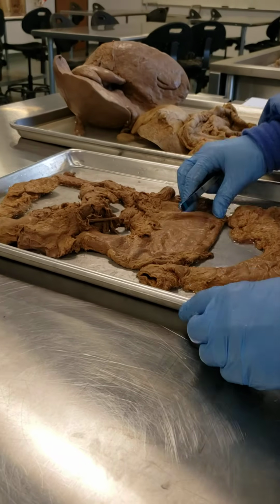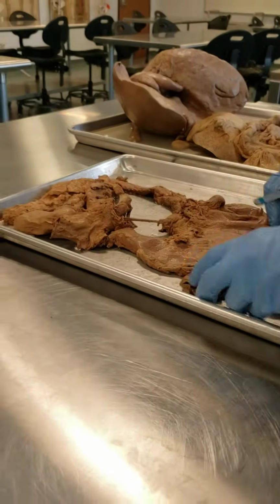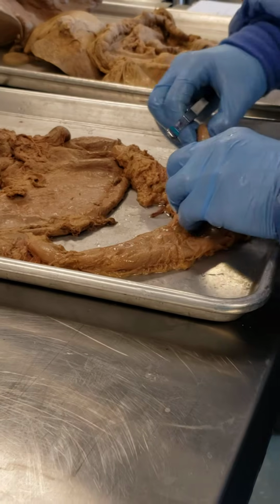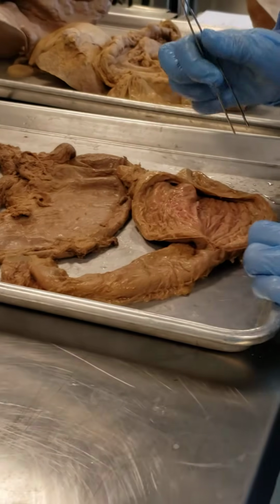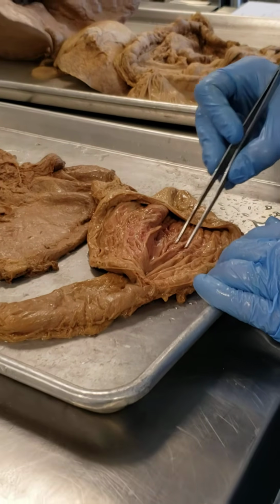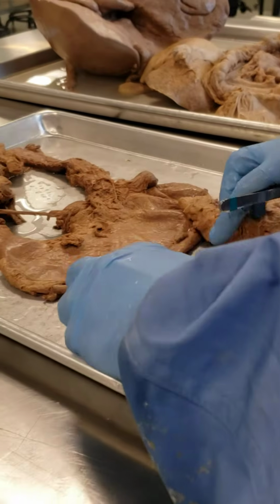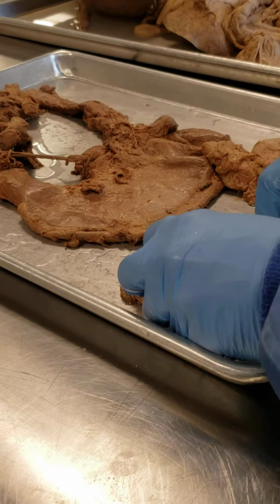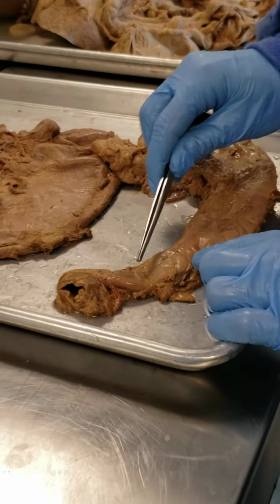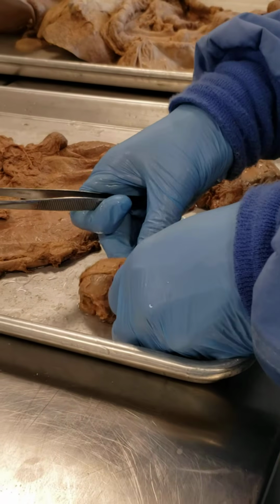Right, everyone, so for part 3, we are looking at isolated specimens. What we have here is the stomach, and if we open up the stomach, you can see these folds inside of the stomach called rugae. Again, these are the folds inside of the stomach. Now, just to point out some landmarks or structures that we talked about earlier, this would be your pyloric valve or pyloric sphincter, okay?